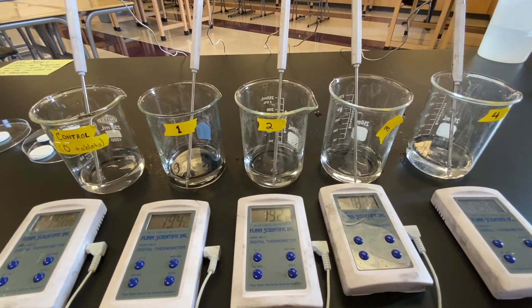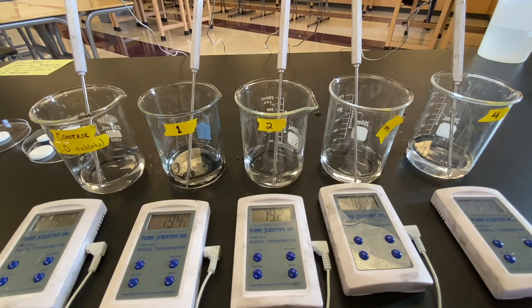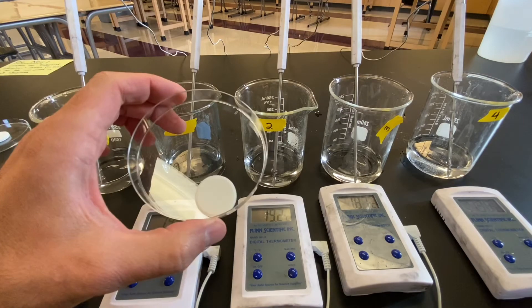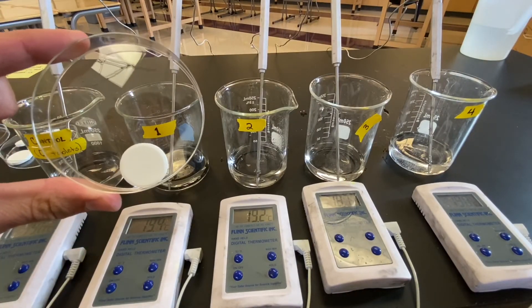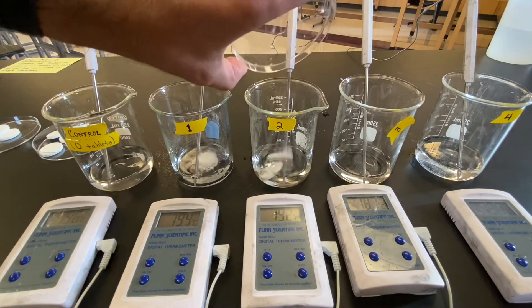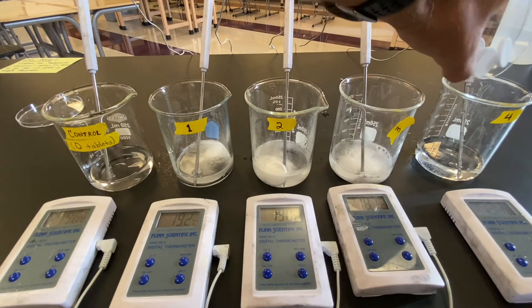I'm going to start adding the tablets now. We're going to watch what happens to the water, which is exactly 50 milliliters added to each one of these beakers, and see what happens to the water's temp as we add those tablets. I've prepared a Petri dish with the appropriate number of tablets in each Petri dish, and I'm just going to go ahead and add them to the beakers. Here's one, here's two, here's three, here's four.